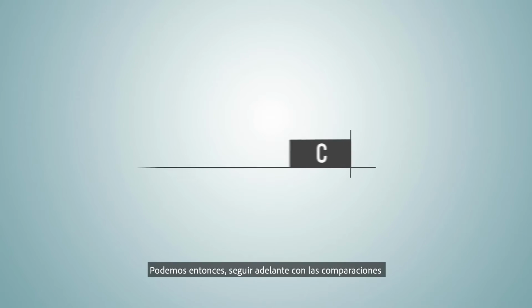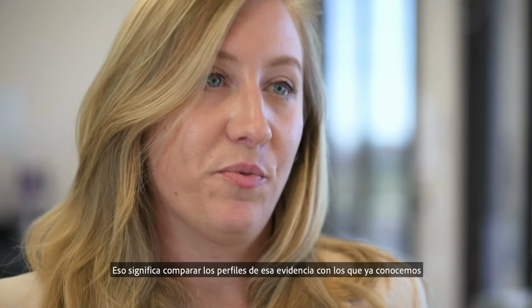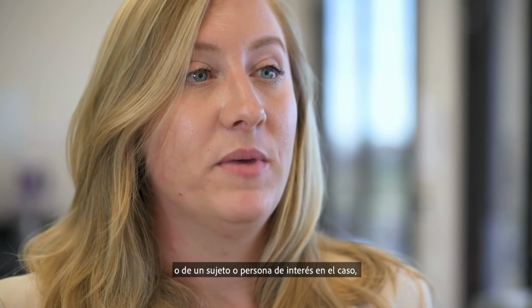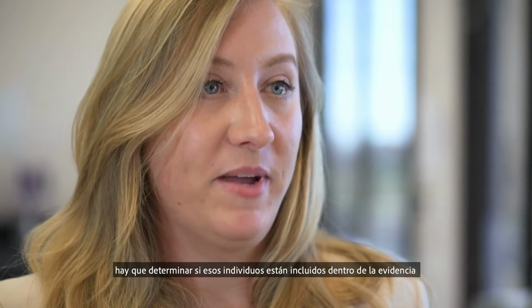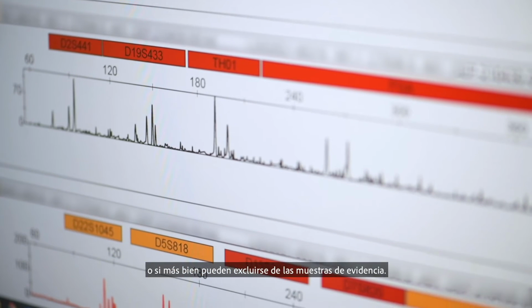We can then move on to comparisons. So that would be comparing these evidence profiles to any known reference profiles that we have. That could be from the victim, or it could be from a subject, a person of interest in the case, to determine if those individuals are included in the evidence or if they can be excluded from the evidence samples.